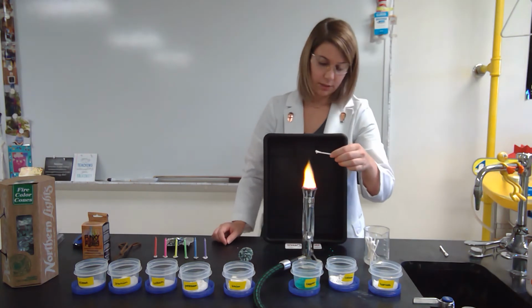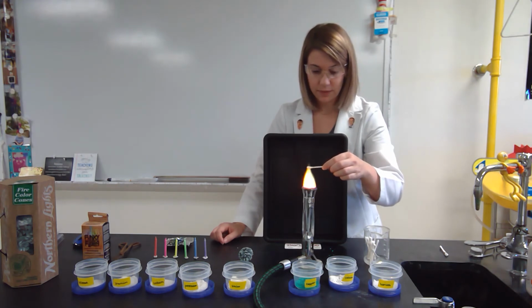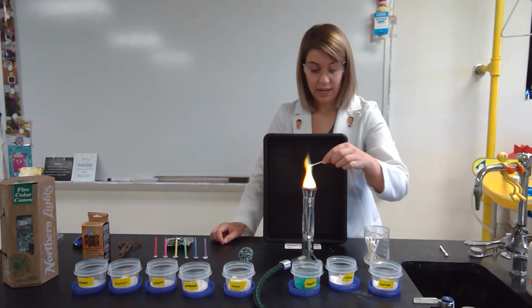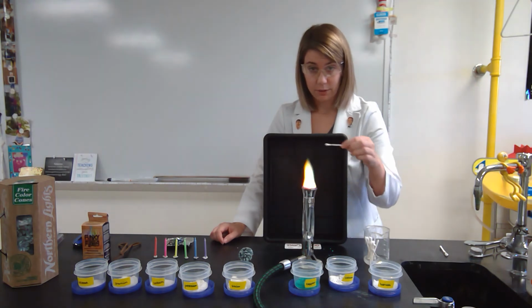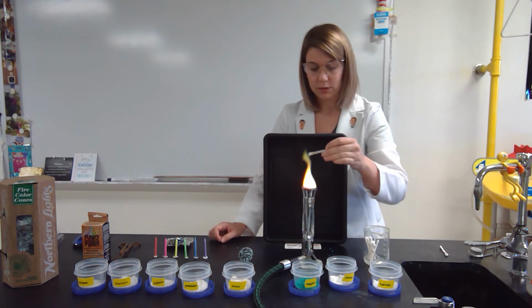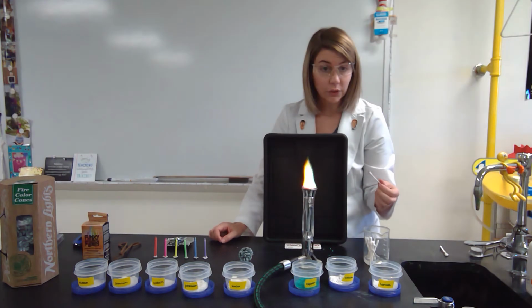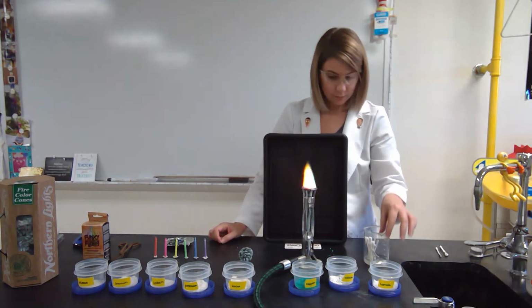Okay, I dropped some on the Bunsen burner on accident, but what color I am seeing is a dark red orange. And as I check my computer as I'm burning this, I see that your colors are not showing up very well. So in your lab paper, I'm going to include a visual of what color it is.